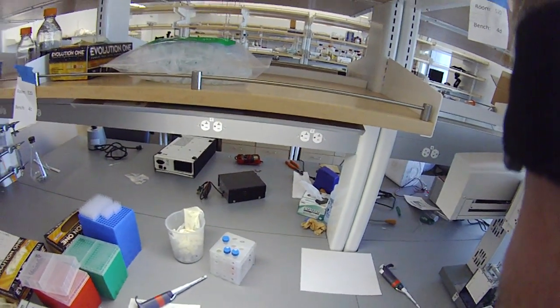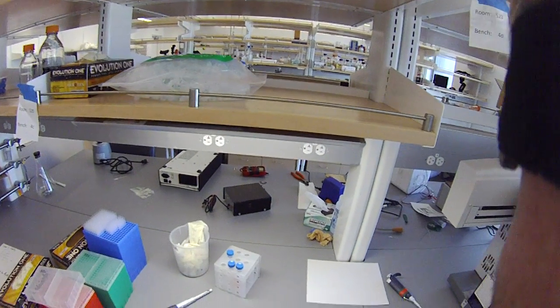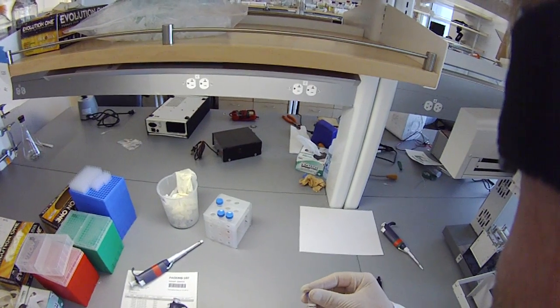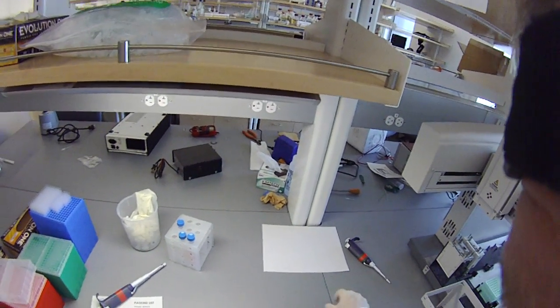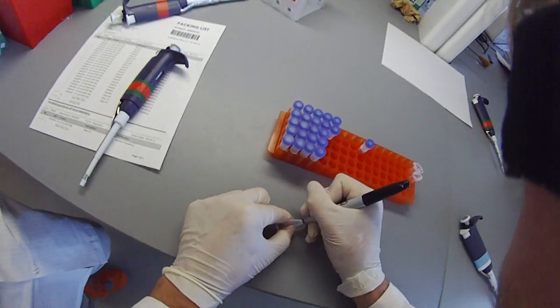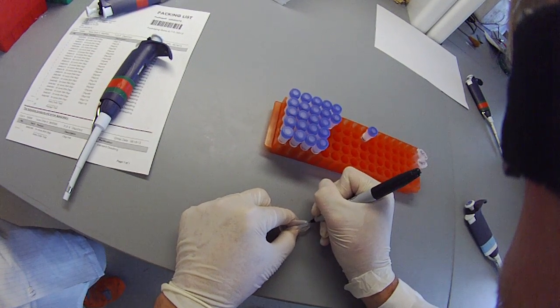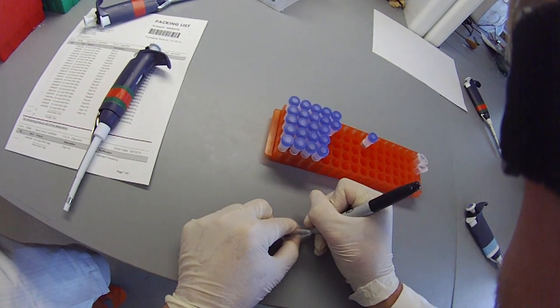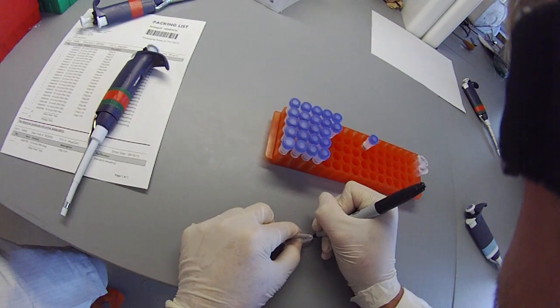We'll do this one by one — it doesn't take much thinking. We're just going to take an Eppendorf tube and label it with the name of the oligo. This one's called oligo 3SB. And I'm going to write on there 10 micromolar.